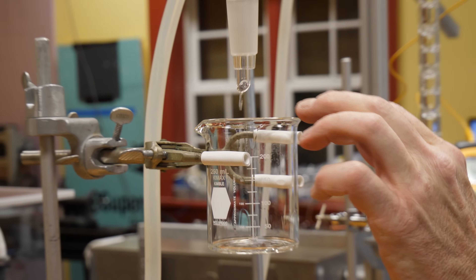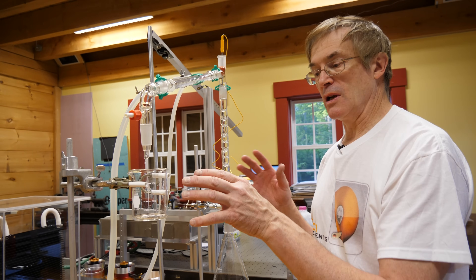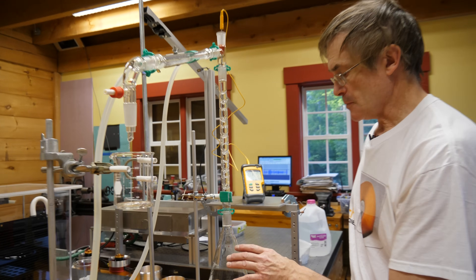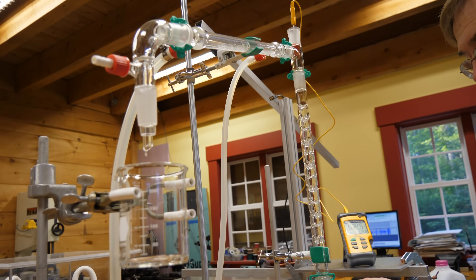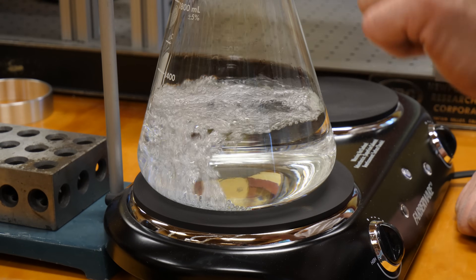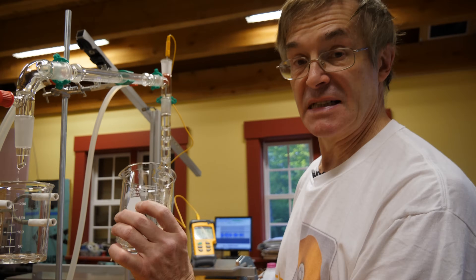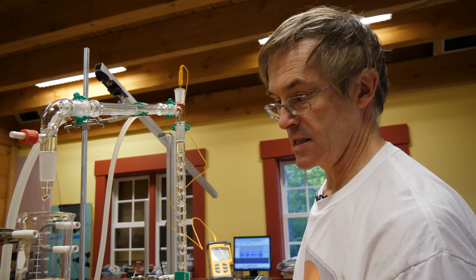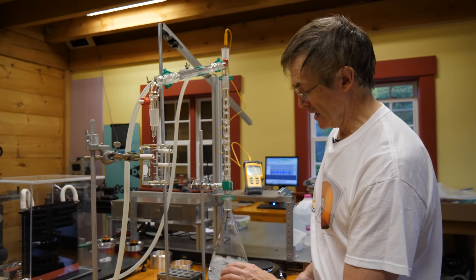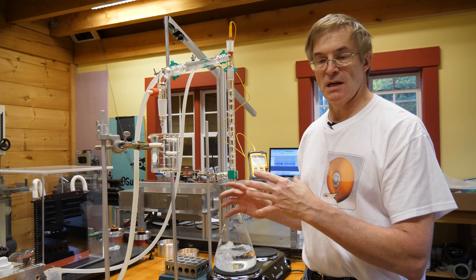As the process continues, the mixture in the distillate will constantly increase in water percentage and decrease in alcohol percentage. The only way to achieve separation is to take off samples at different times or stop the process partway through. The distillation process is never really complete — even at the bottom of the flask some alcohol remains, and even the very first drops contain some water. But the percentages are substantially different, and we'll measure specific gravities on the first and last liquids to show how density indicates component concentrations.